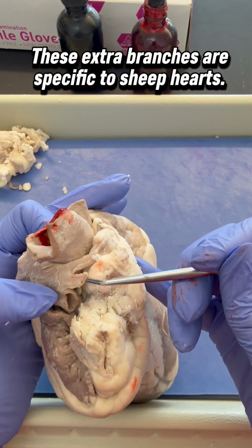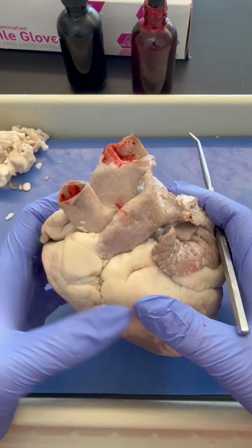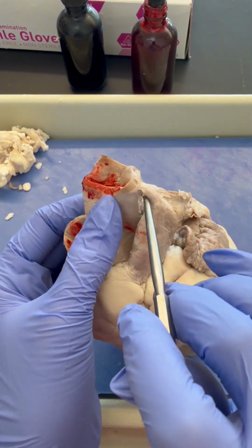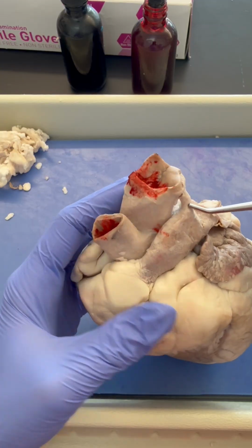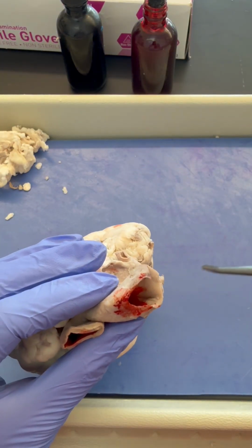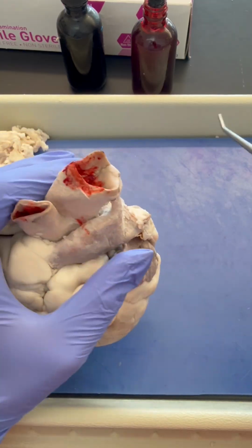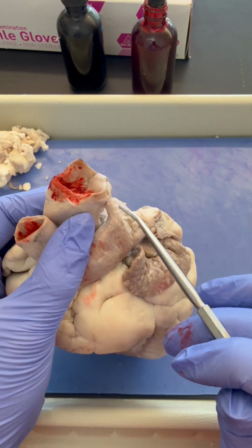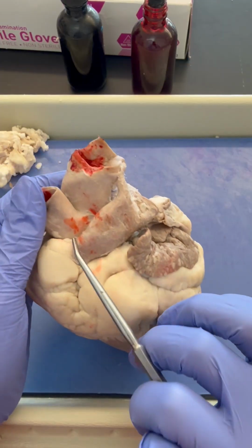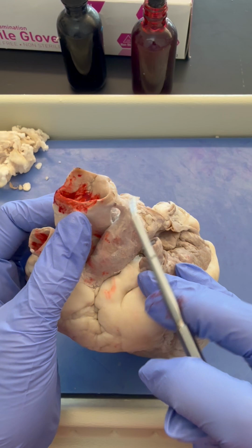So you'll notice there's this tube here that's connected and this tube here that's also connected. Another thing I want to point out is this structure here. This is our ligamentum arteriosum. So it is not a tube. It is closed up. It's attaching the pulmonary trunk to the aorta. It is thought to be a remnant of the fetal ductus arteriosus. In the adult sheep, it's just attaching the pulmonary trunk to the aorta. And we actually have this in humans as well.